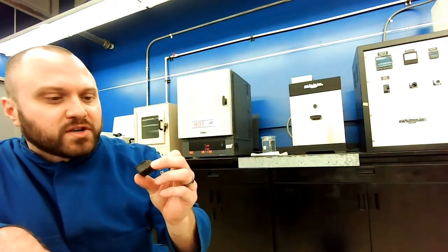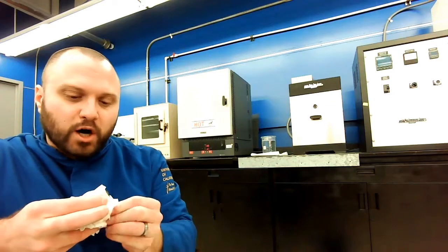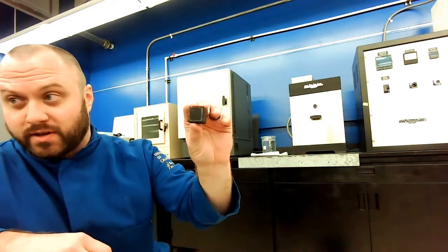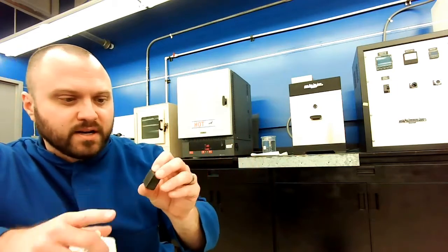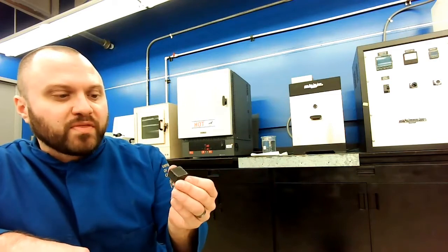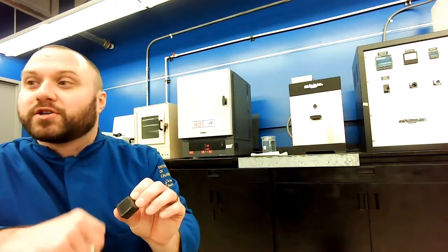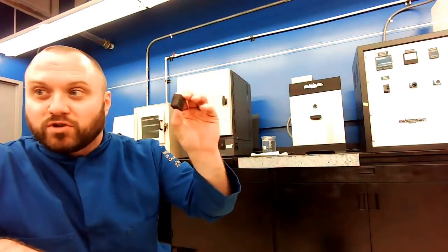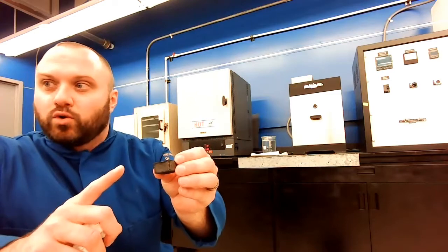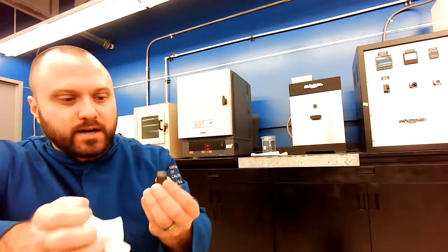But anyways, what we're going to have to do is polish back, take this material off before we look at that surface and measure the surface properties. So we'll actually end up doing that next week. I'll show you how we can take that off. We want to take that surface material off, but we want to stay relatively close to that original surface. Remember, we're taking this block that's really hot, putting it into a bucket of water. This block won't uniformly cool down. The outside is going to cool down faster than the middle. So we're going to make sure we look at the outside of the structure.